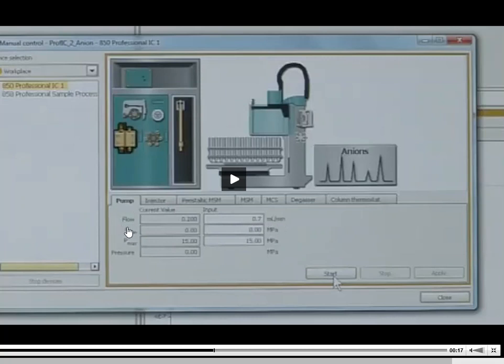It shows me the P min and the P max. So this is minimum pressure and maximum pressure before the system cuts itself off. What I would want to do with the purge is go to the pressure minimum and change that to 0. The reason I'm changing that to 0 is because I'm opening up the purge valve and trying to get rid of an air bubble. And I know that this system is not going to hold any type of pressure at all because I've opened it up. If this had a number there, let's say a 1, when the machine falls below a 1, it stops. It doesn't pump anymore.